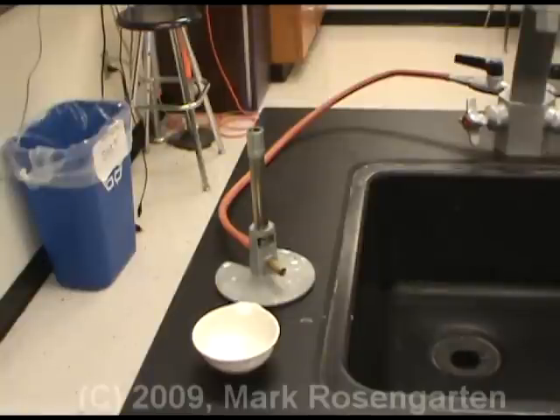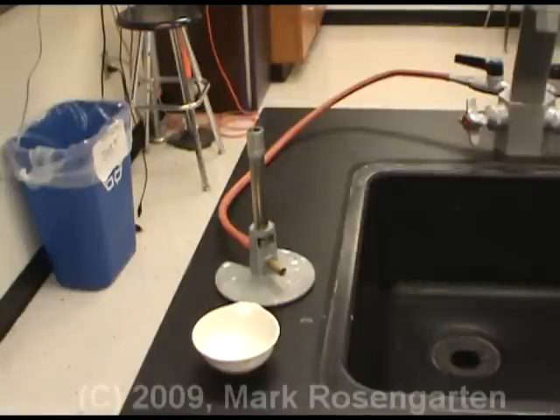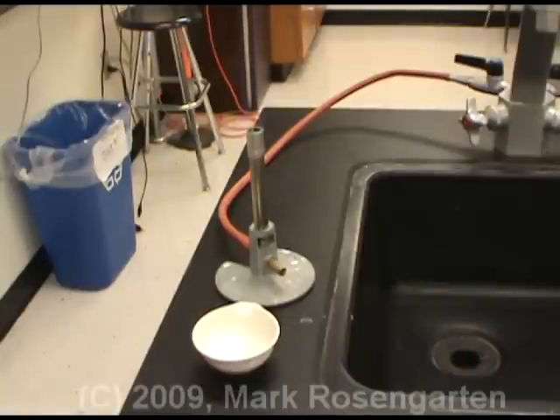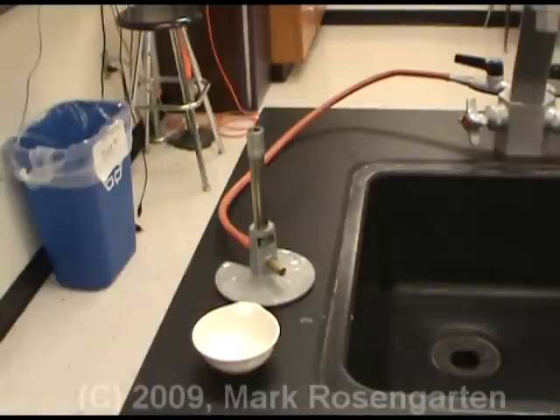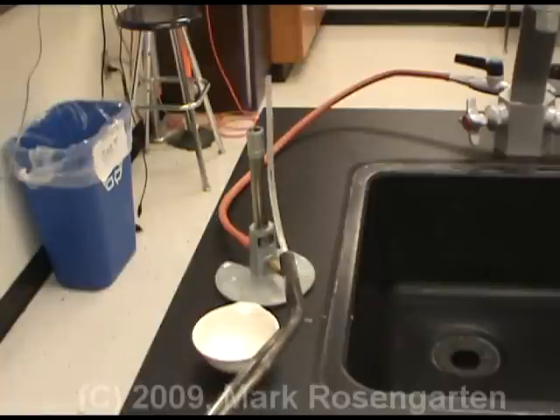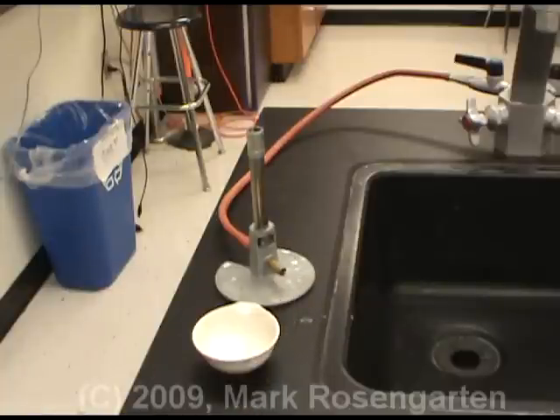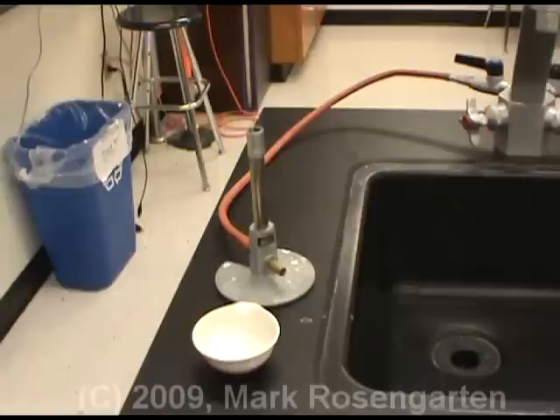The following chemical reactions you are about to see are examples of chemical changes. They take substances, like magnesium, and turn them into new substances.